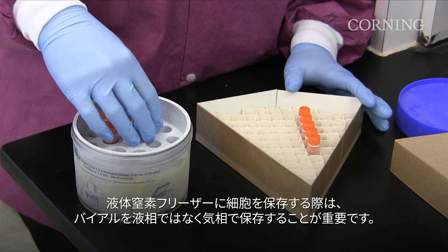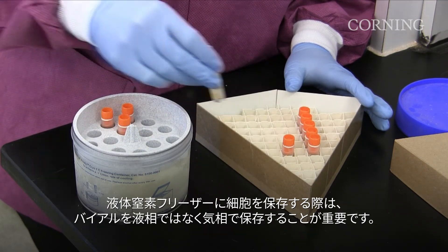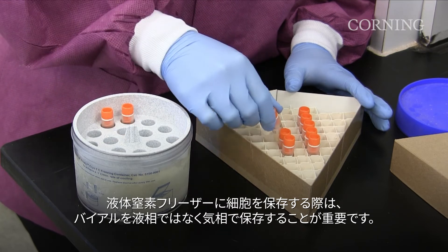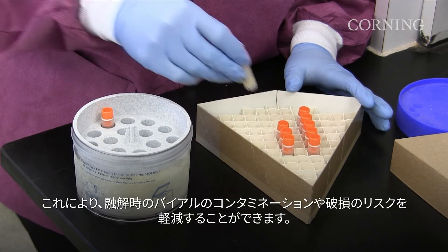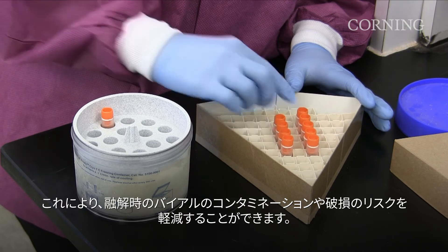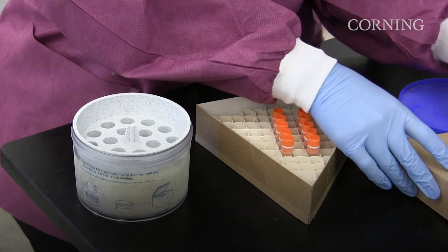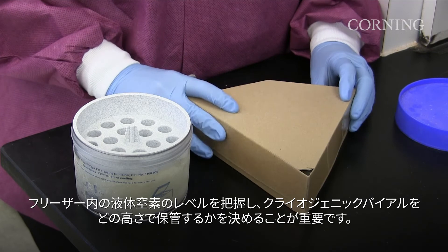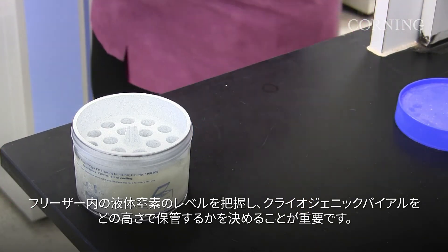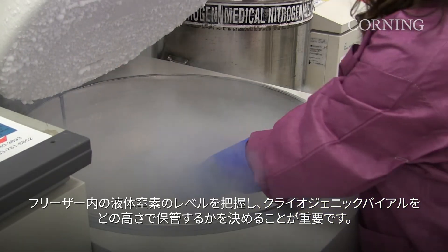When storing cells in the liquid nitrogen freezer, it is important to store the vials in the vapor, not the liquid phase. This will reduce the risk of contamination and damage to the vials during thaw. It is important to know the level of liquid nitrogen in the freezer to determine at what height the cryogenic vials should be stored.